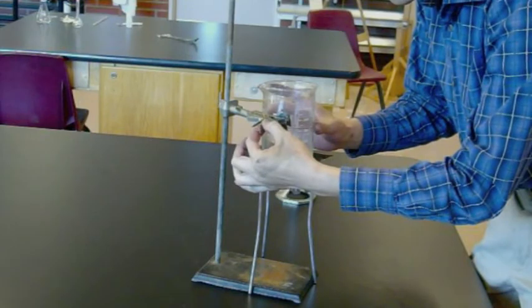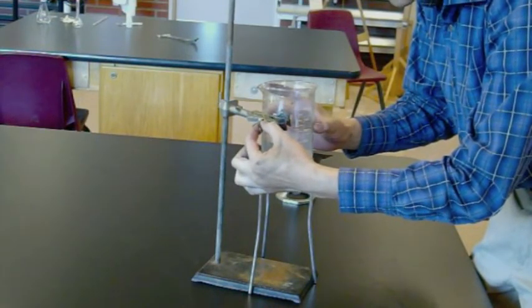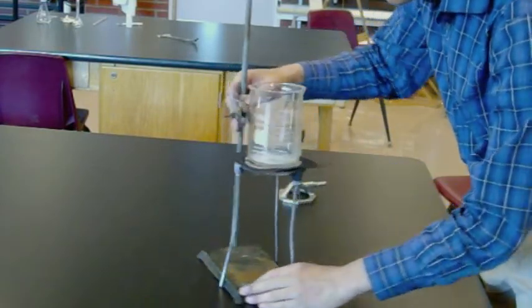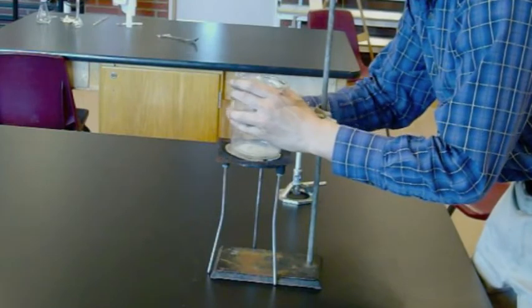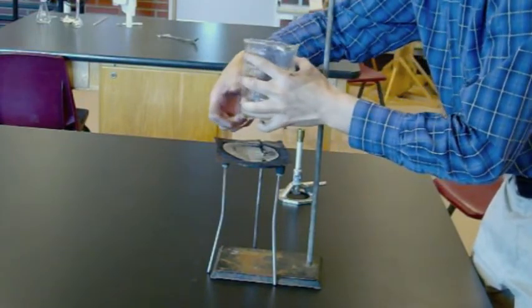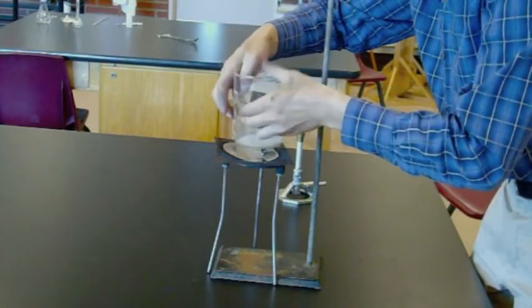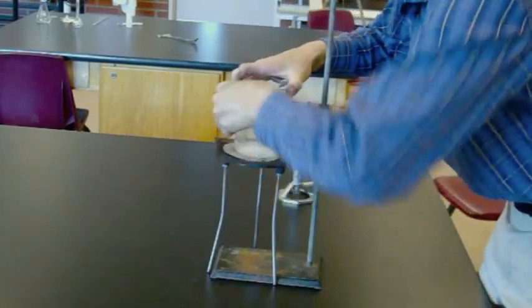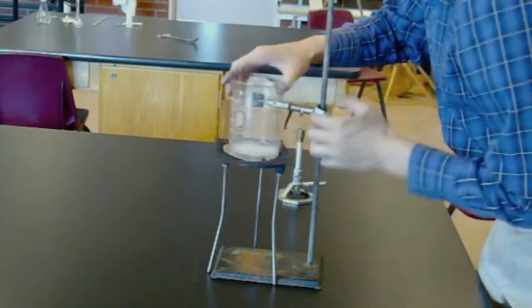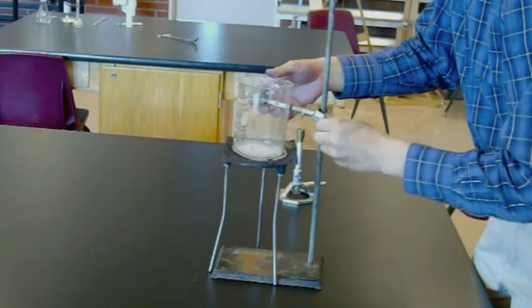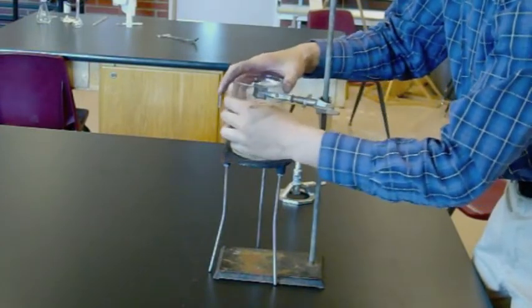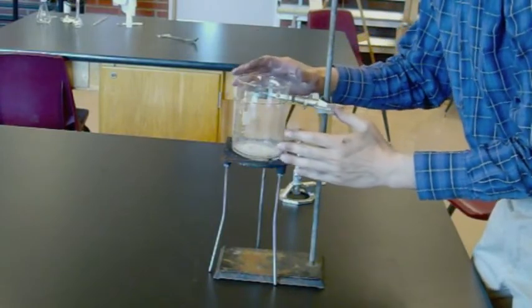Right now I've twisted the copper wire shut on the test tube clamp side of the wire. But actually, you can get it tighter if you make your wire knot on the other side of your beaker because you don't have to work around the test tube clamp. So if you tighten this up over here, you can actually get it much tighter and get a much more stable base. Again, a little closer to the top is better, but you want these sharp ends facing down to decrease the chance of you getting poked by it.